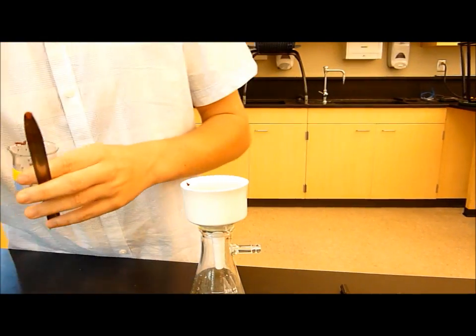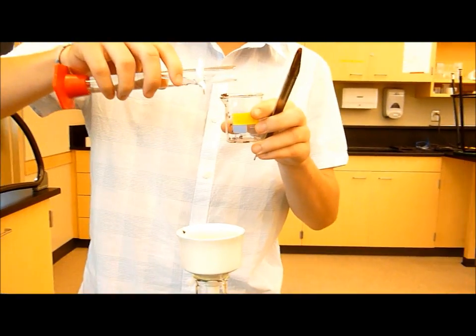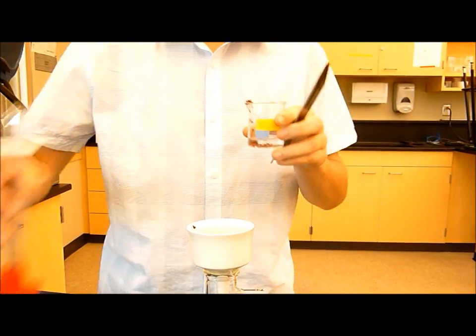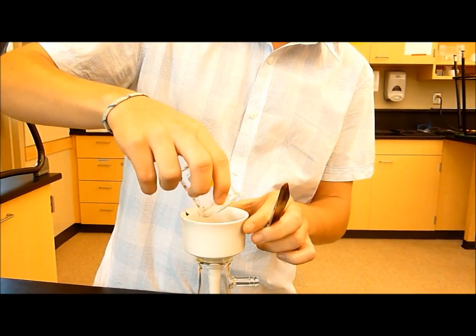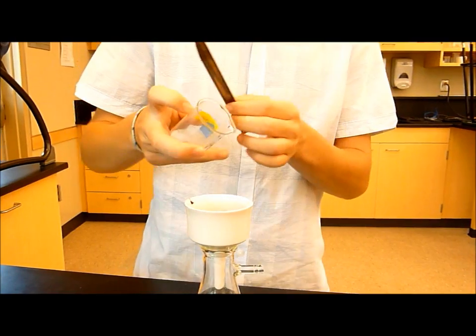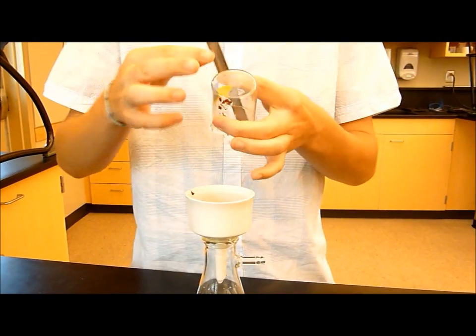So, I'm actually just going to add some distilled water in here, so that I can get the rest of this out. Pour it out, and it should filter through. As you can see, the water is dripping down.